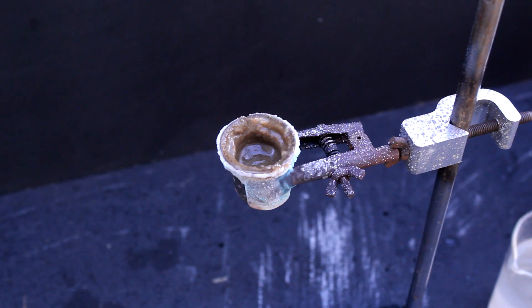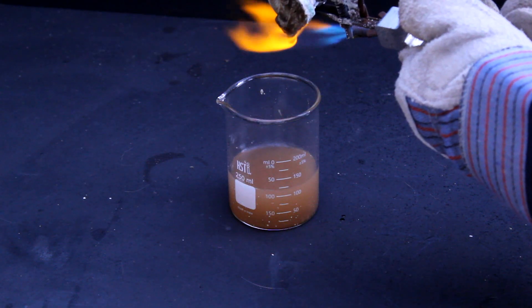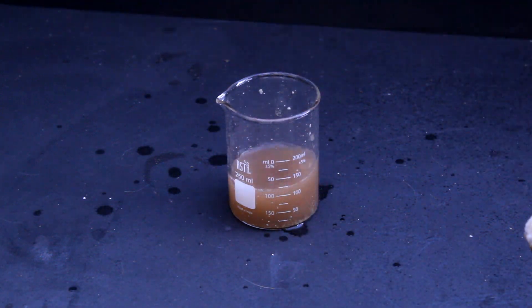After a while, the glass will be fully dissolved into the sodium hydroxide. At this point, allow the mixture to cool and then submerge the vessel into water to dissolve out the sodium silicate. Don't add the molten mixture to water, as it will burst explosively and could damage your glassware.